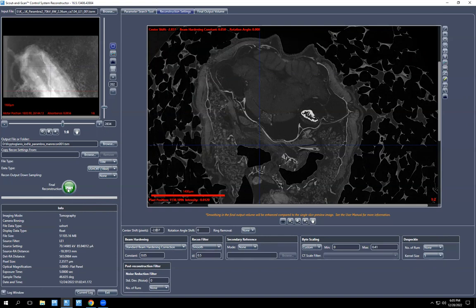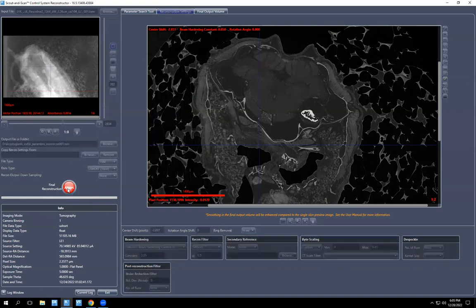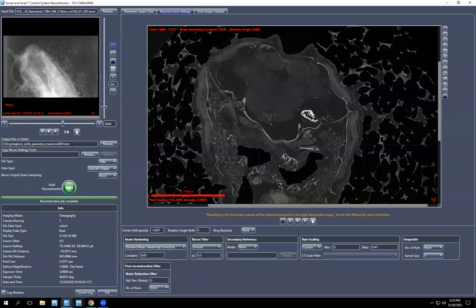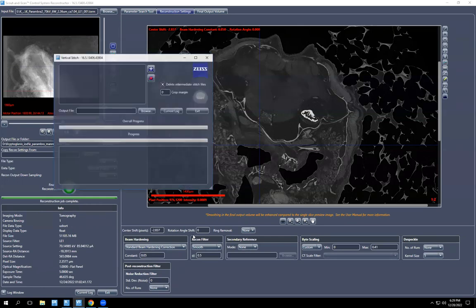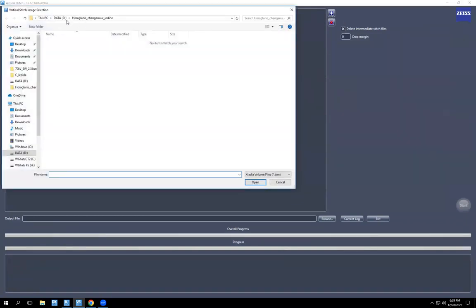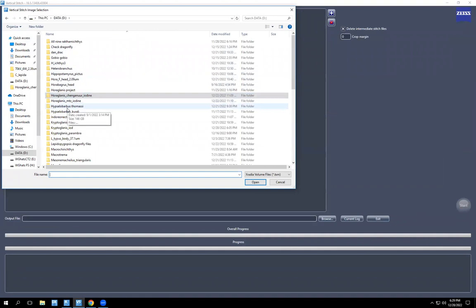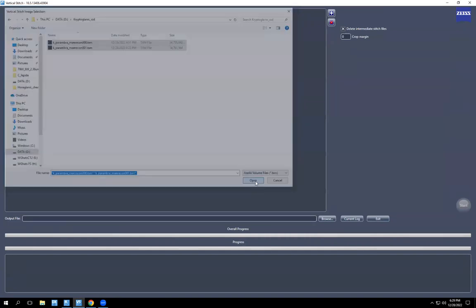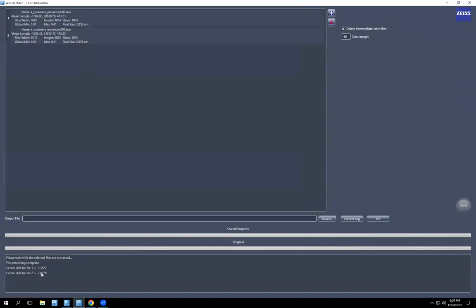So we hit start and let the computer do its thing, and then you have to stitch. How to stitch. All right, the reconstruction is done. Now we can do stitch. Open stitch. Hit this button. Find your manual reconstructions. Shift, open both. At this point, if you have messed up and have the incorrect something somewhere, you'll get error messages here. Like if your byte scaling isn't the same.